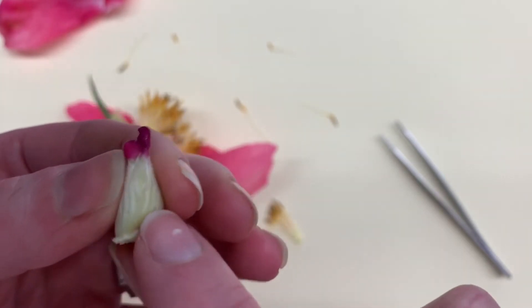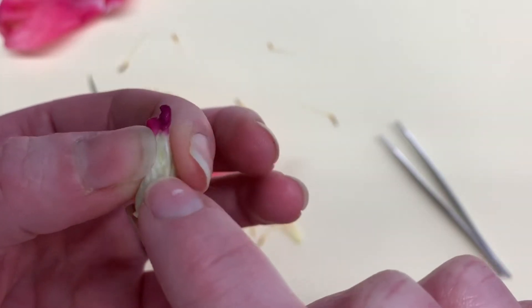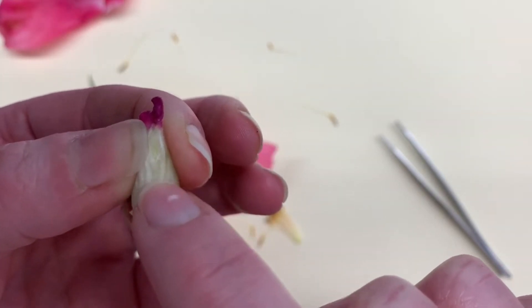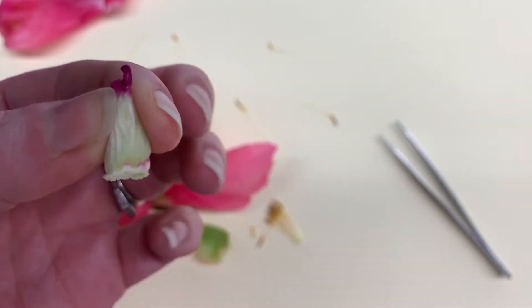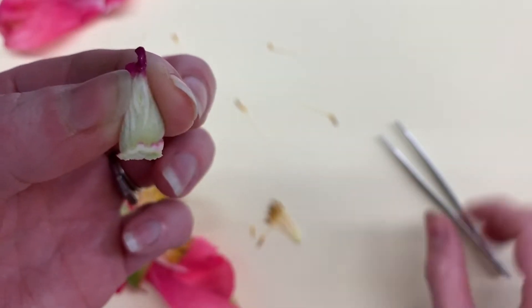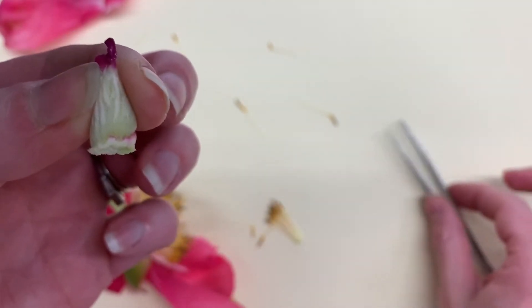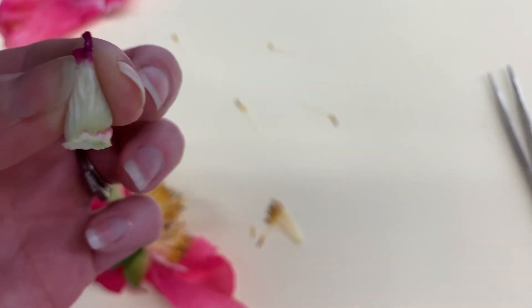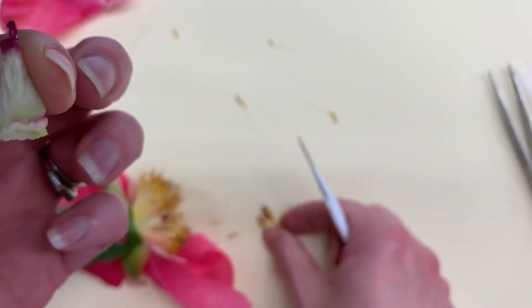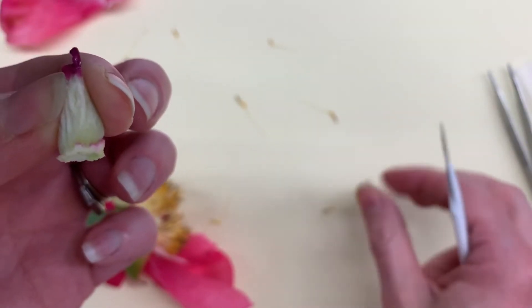The sperm travels down through the style to the ovary at the bottom. The ovary is what turns into a fruit once the flower is matured and the eggs are pollinated.